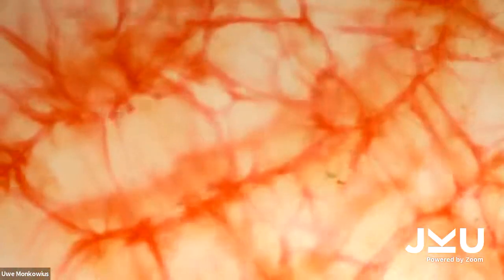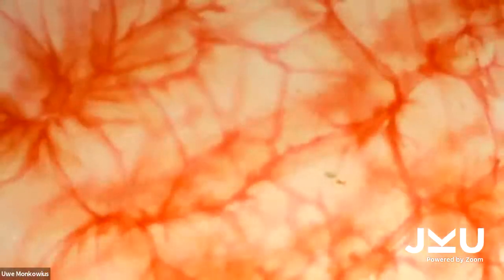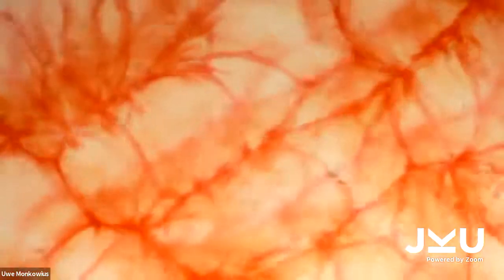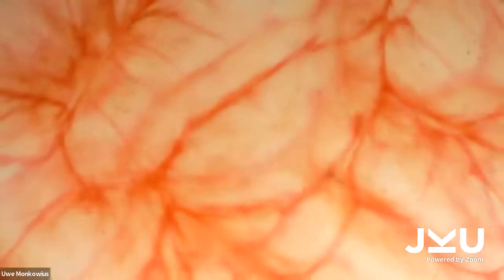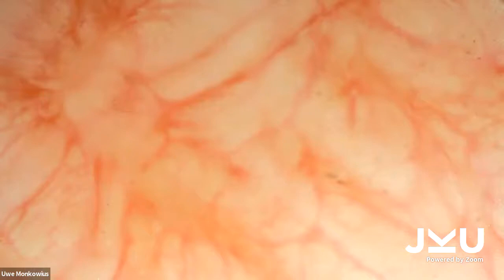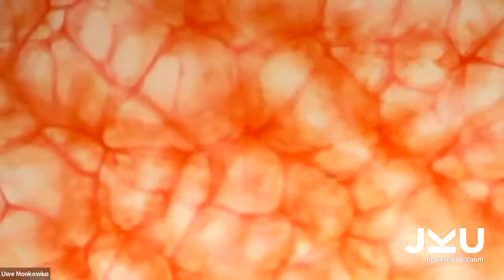You also can see the flow because of the surface tension. Now we will show you how important the oxygen is, because when we put a glass dish onto the petri dish, so the air is excluded, you can see the motion, the pattern stops. Everything gets colorless, and when I remove the glass dish so oxygen can go to the solution, the flow and the pattern starts again.